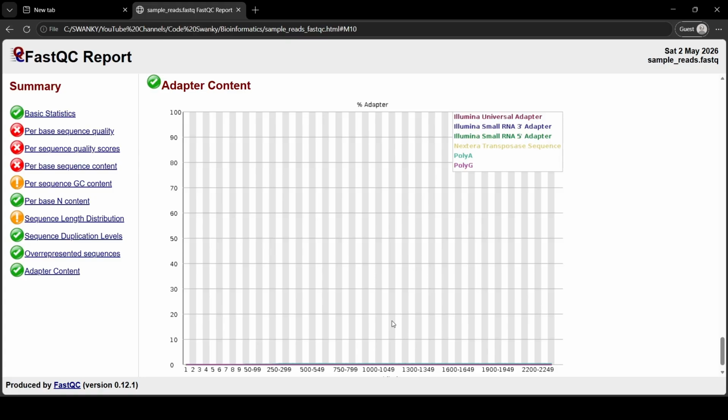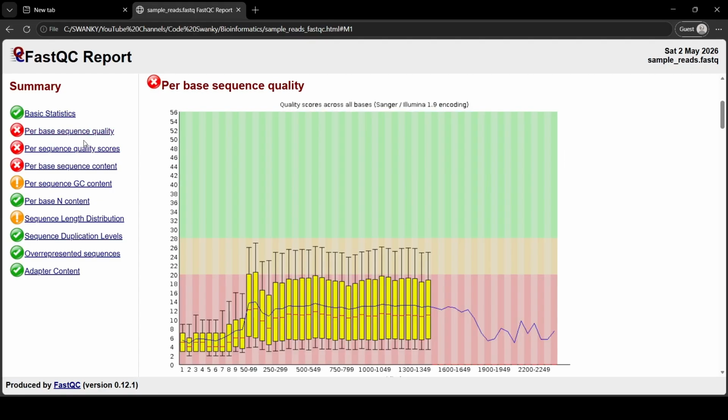So you now know how to generate an industry standard quality report from the command line and how to read the most important diagnostic plot in genomics. Okay, so what do we do if this FastQC report shows a big red X for quality at the end of our reads, and a huge spike in adapter content as well?